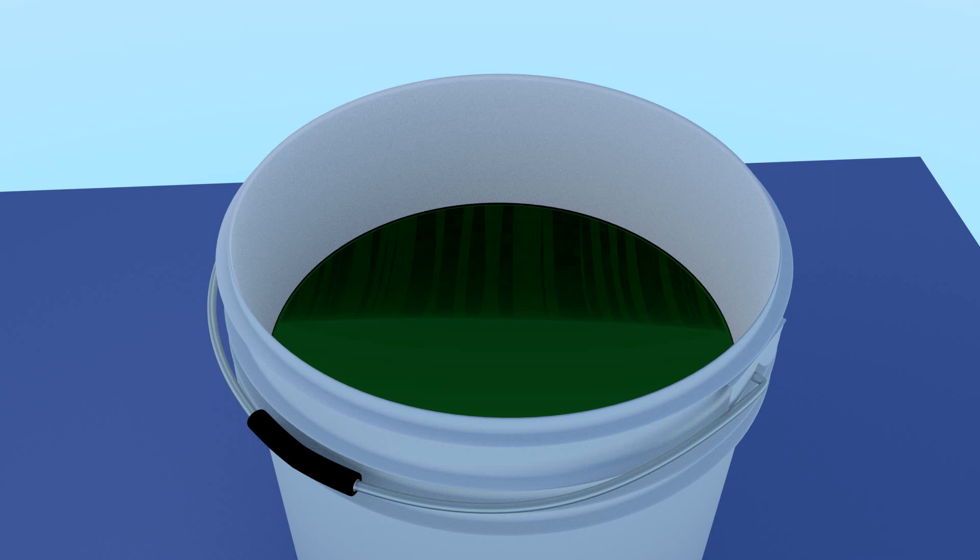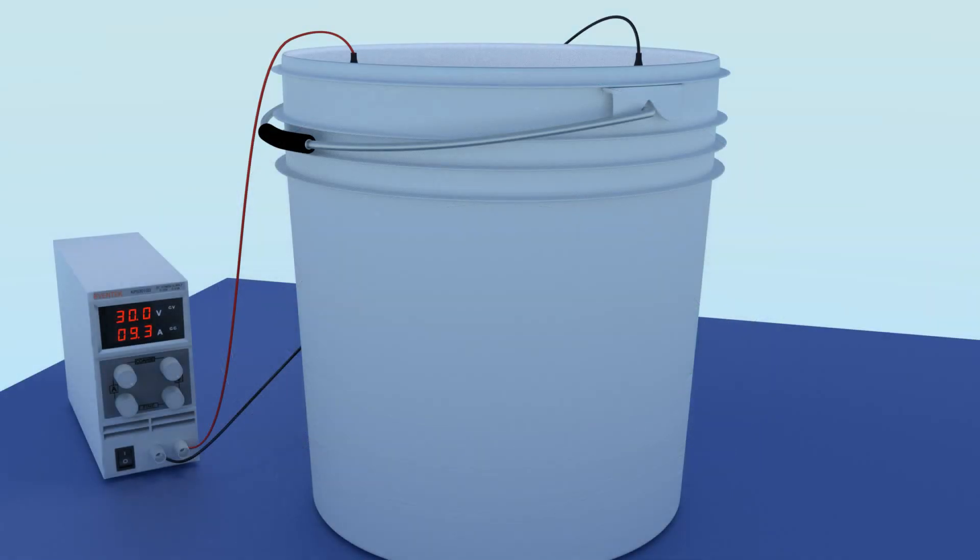Want to recover the base metals from your spent aqua regia solutions? This video details an easy and environmentally friendly method of recovery.